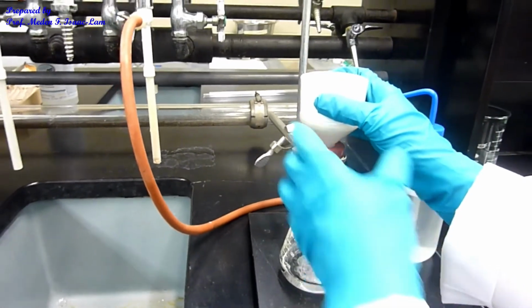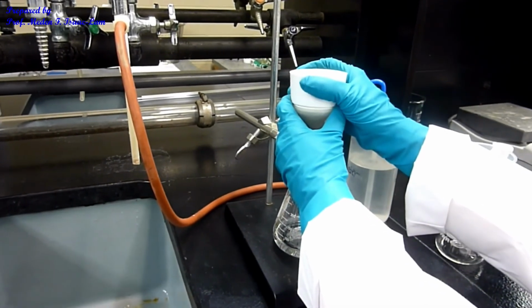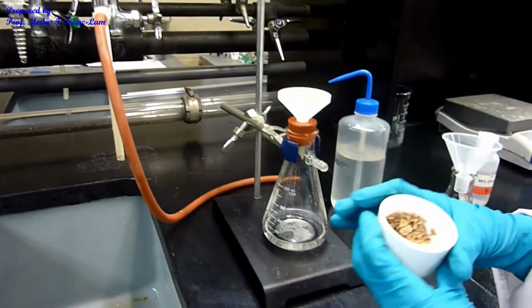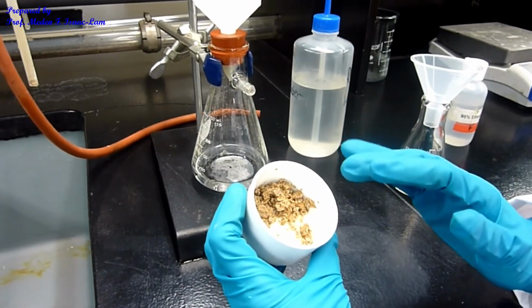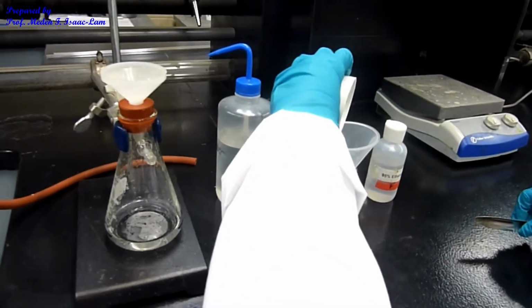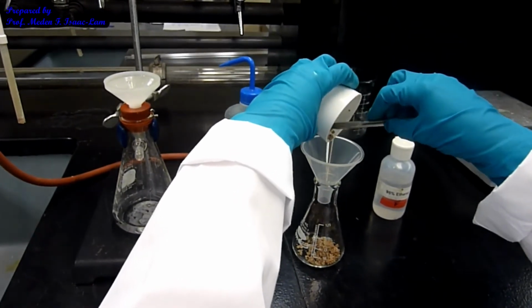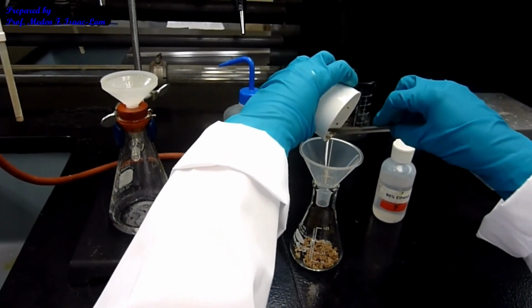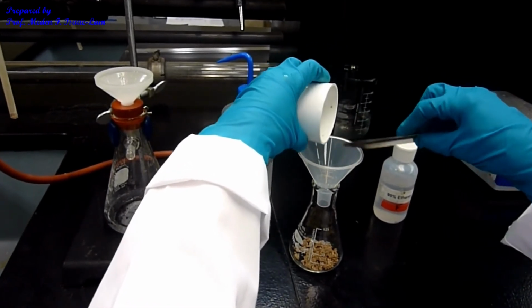This is now the benzamide derivative that we made from the amine, and as you can see, the appearance doesn't look entirely clean. So I want to recrystallize this. I'm going to transfer everything in here. So I should have enough sample to be able to analyze the compound.